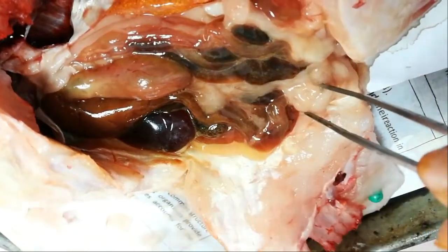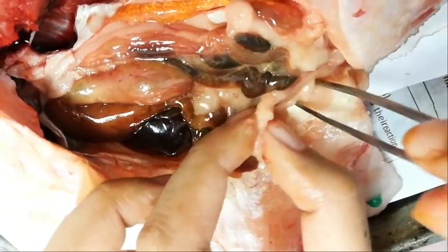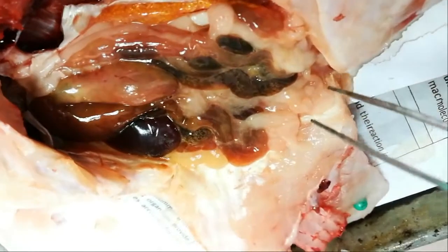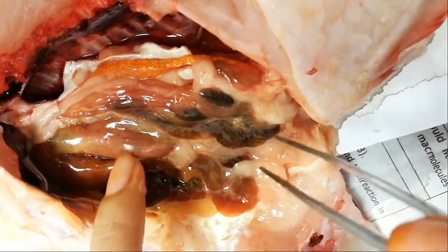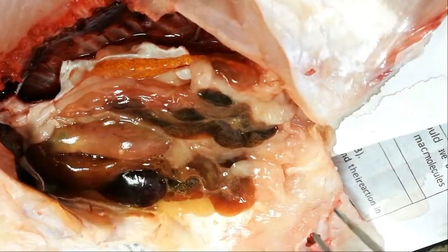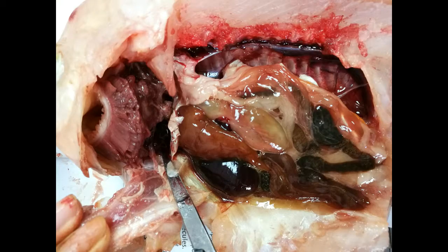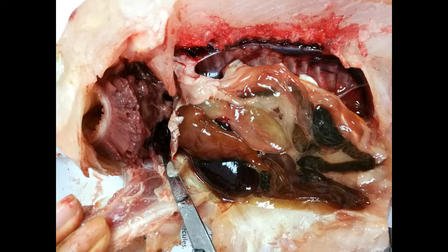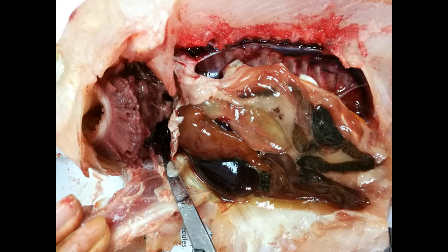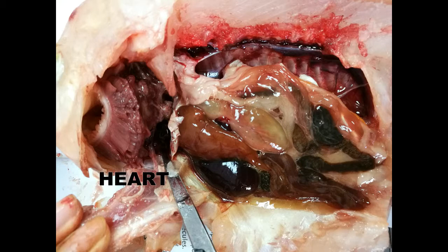At the bottom of the stomach is the intestine. The greenish color at the center is the gallbladder, and underneath it is the spleen. The operculum of the fish was also cut open to show the gill beneath it — you can see the gill raker, gill arch, and also gill filaments. The heart of the fish is located at the bottom.